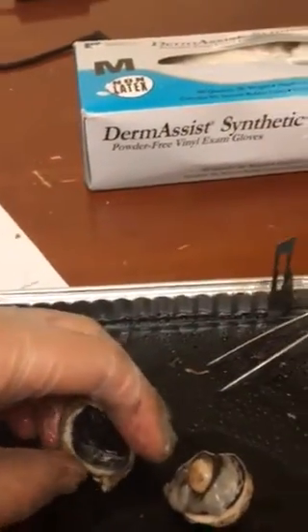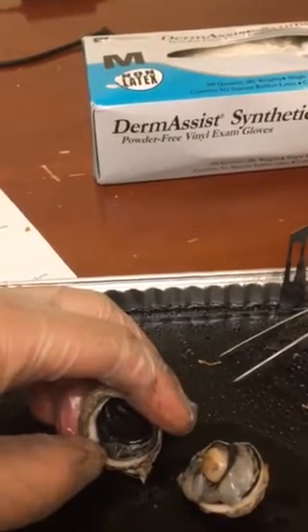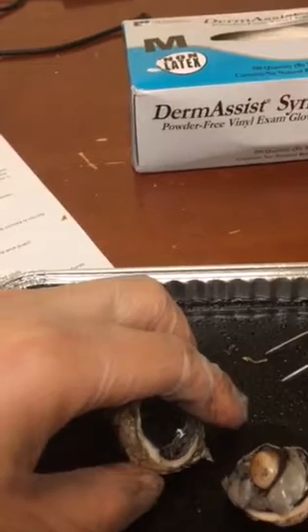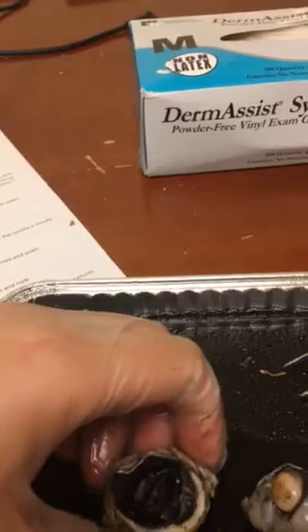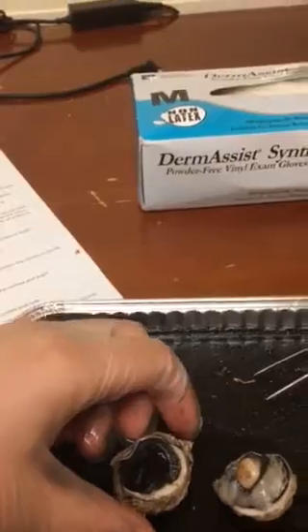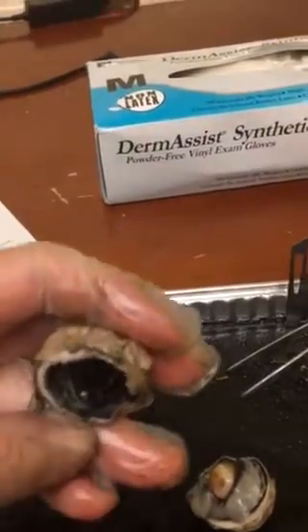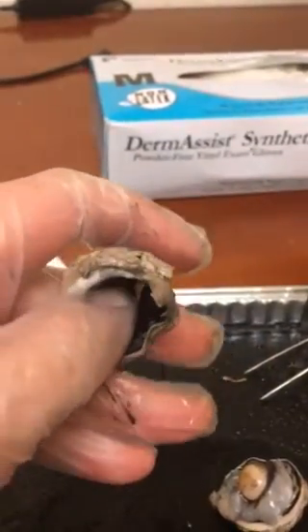I was not able to remove my lens. I apparently am very bad at dissecting and I can't find it when it leaked out. But we're able to observe the vitreous body, and that is a cavity between the back of the lens and the retina. And then the lens is a biconvex transparent structure that focuses the light coming in through the cornea and the pupil. And then I'm kind of able to see a little bit in there through where the lens should be.